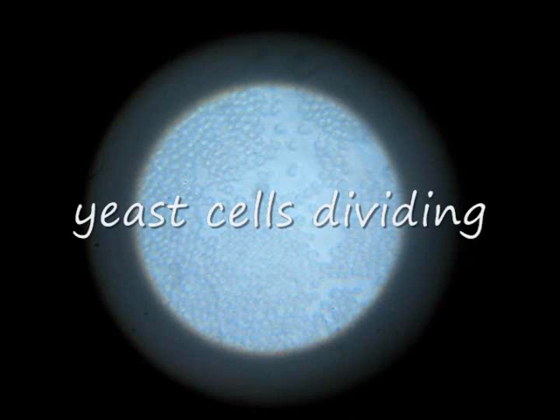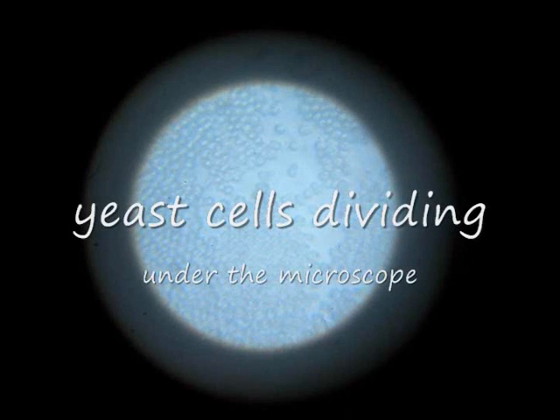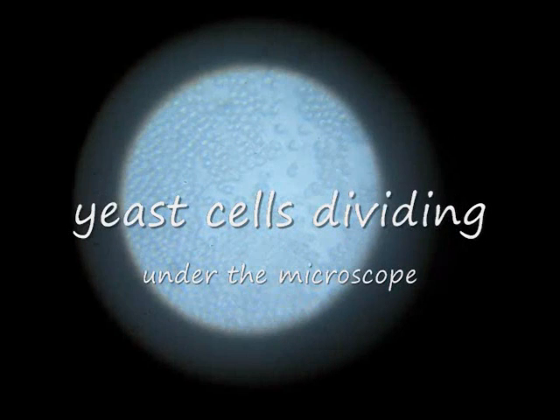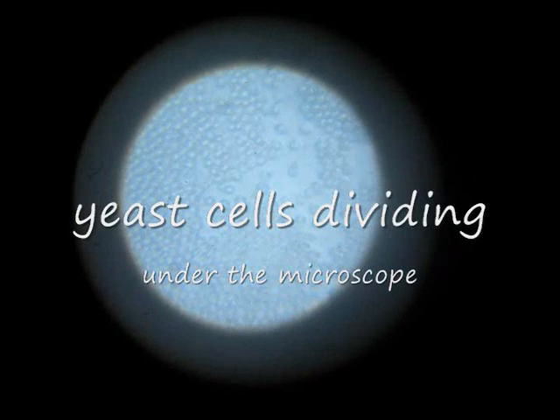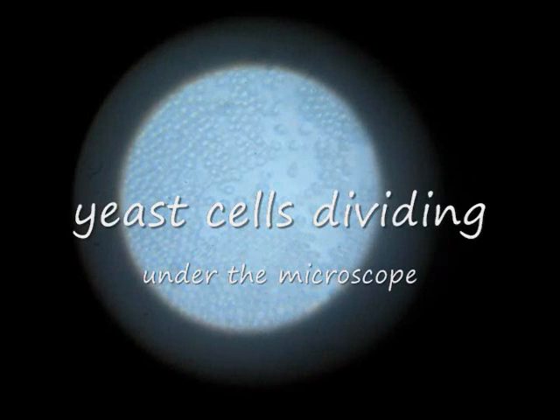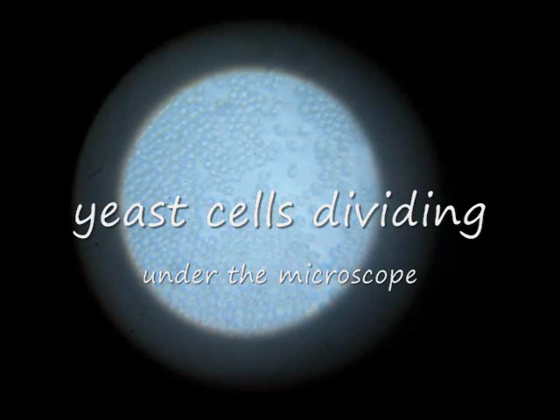This video is about yeast cells dividing under the microscope. You will be able to see single cells coming off of other cells, which is obviously a division.